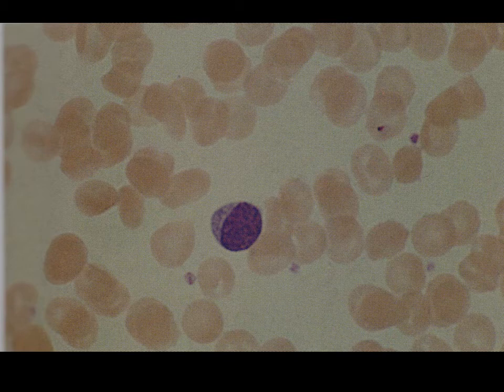Next up, we have a lymphocyte. And so lymphocyte always kind of reminds me of the moon. So lymphocyte, lunar, kind of a thing. It almost looks like a crescent moon type of appearance to it, almost as if part of it was in shadow here, and all we're able to see in a sense is this portion of the moon that's there.